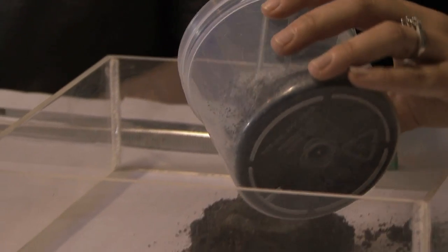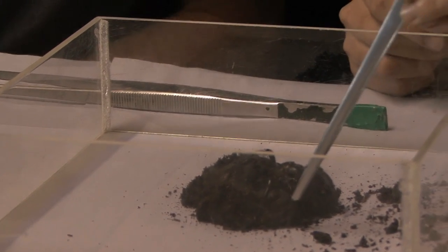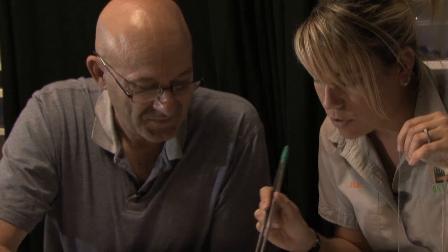Come on, miss. I'd hate to see the big female. She seems to be rearing and ready to go. You should be able to just run your pipette just up and down the fangs, but particularly at the tips. I'll try and stimulate her to produce a few venom droplets.